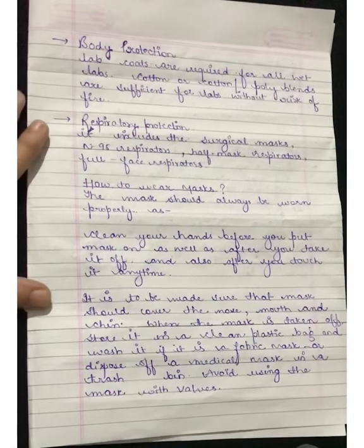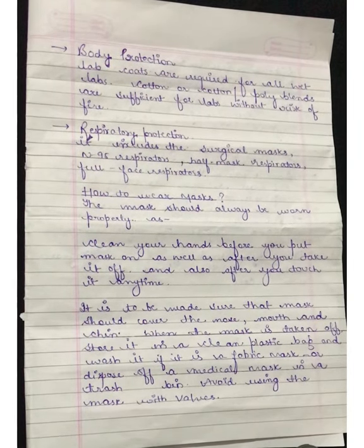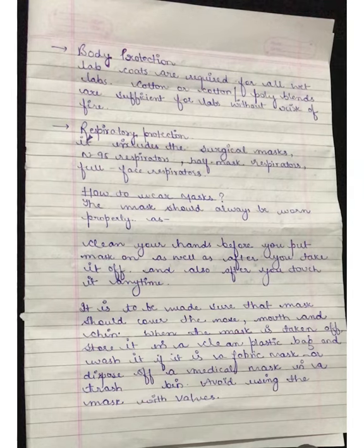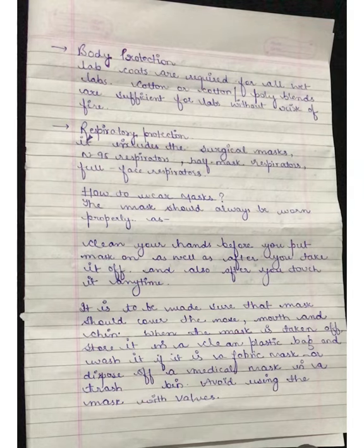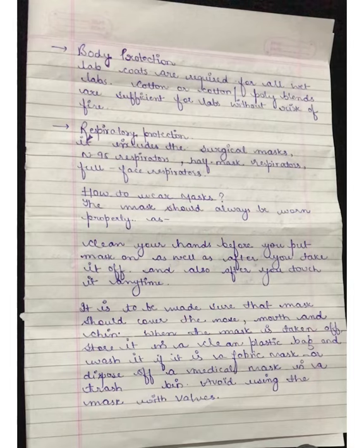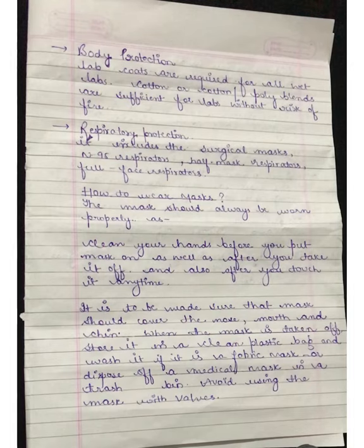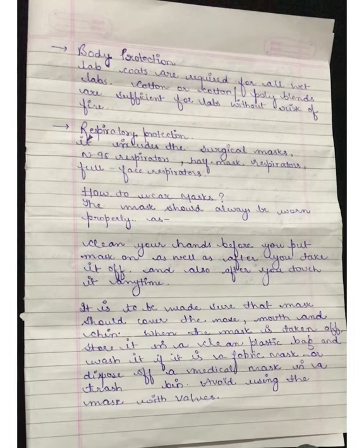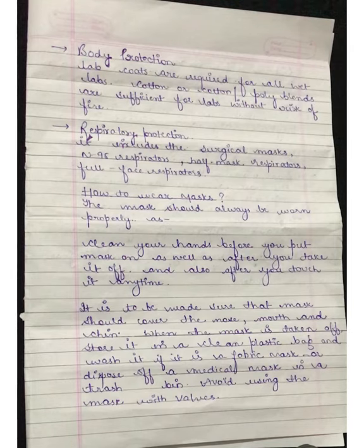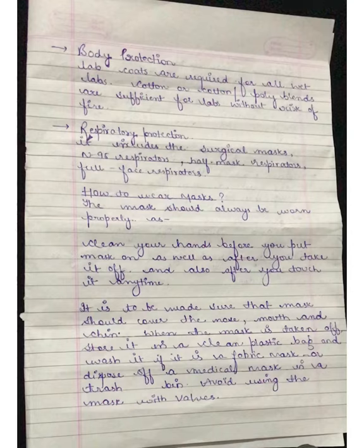Next is body protection, which involves protection of the body or clothing of the individual. Lab coats are required for all wet labs. Cotton or cotton-poly blends are sufficient for labs without the risk of fire. Next is respiratory protection, which includes surgical masks, N95 respirators, half mask respirators, and full face respirators.